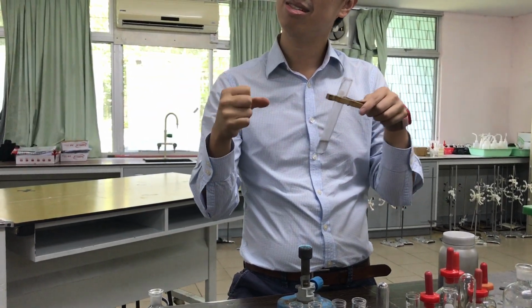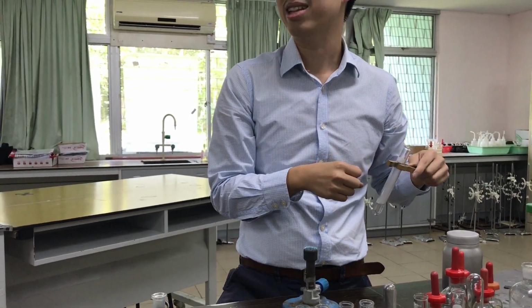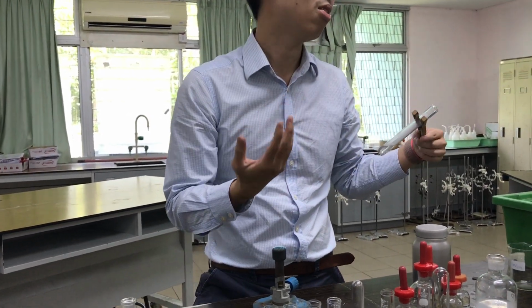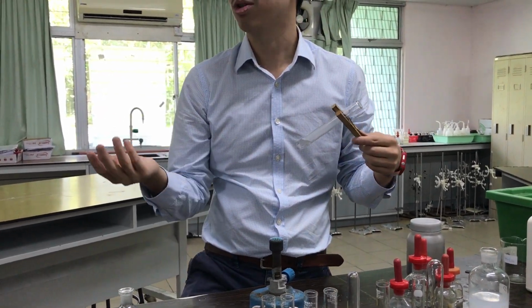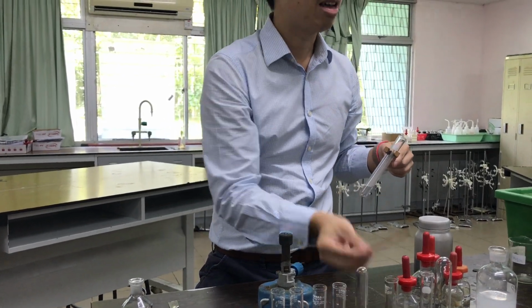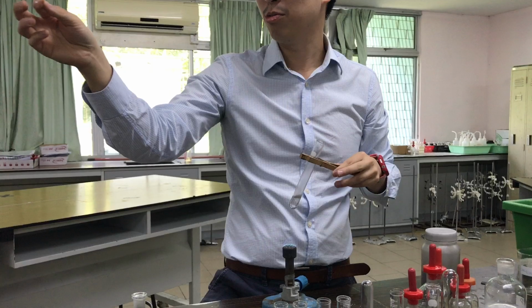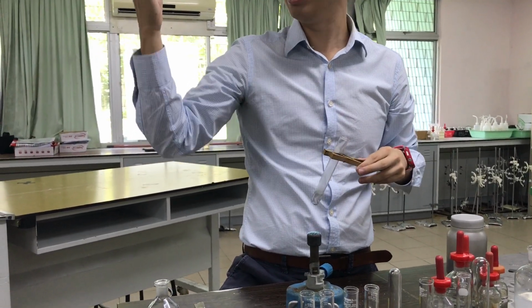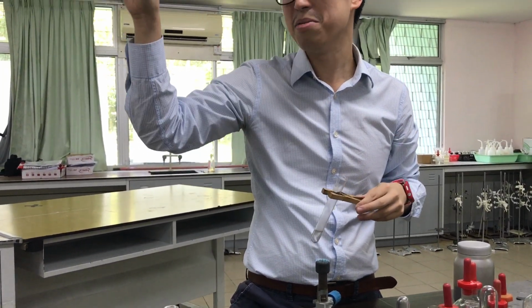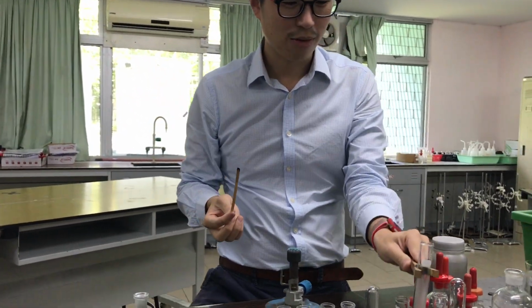2 hydrogen, 1 oxygen, lower secondary from Year 1 science. You drink it every day. H2O. Yeah, which is water. Do you use water to put out fire? There was fire and water is being formed as the hydrogen reacts. Can water support burning? Will it continue burning if you produce water? No, the fire will go out. Agree? Okay, test for hydrogen, okay?